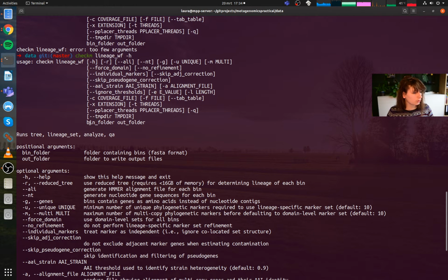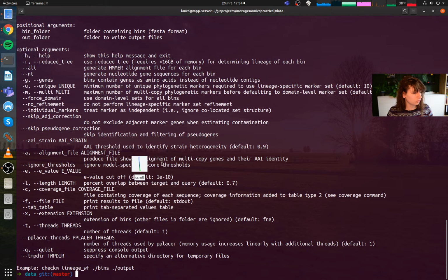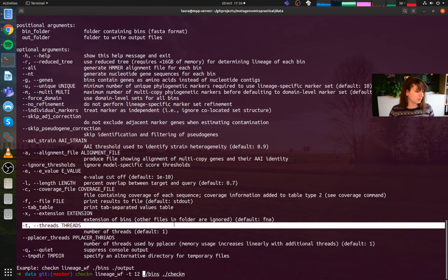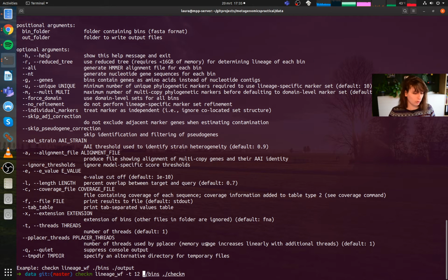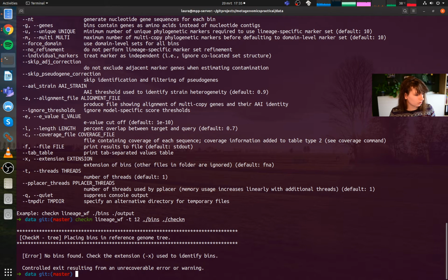Whole bunch of options that we're not gonna use. A bin folder and an out folder. So the bin folder we know. That's bins. And let's call the output folder CheckM. Makes sense. So we can quickly look at the options. Something that you can't really do in this practical because we share one computer with all of us. But what I can do here is give it a bunch of threads. So threads, let's just call CPUs. By using all the 12 CPUs on this system, the whole calculation will be a bit faster. I hit return. Oh, come on.